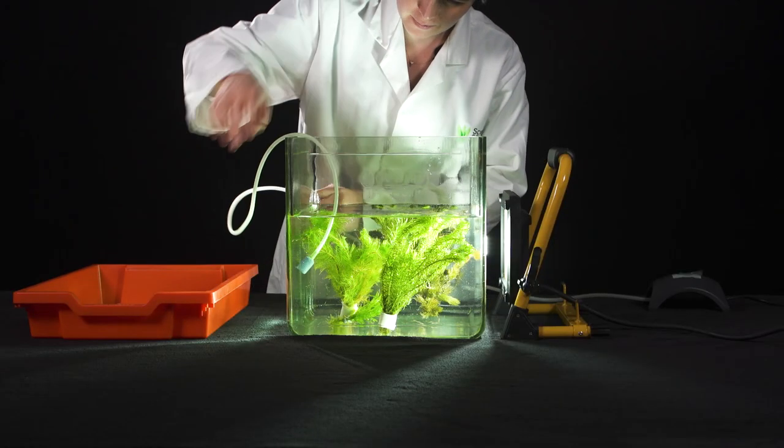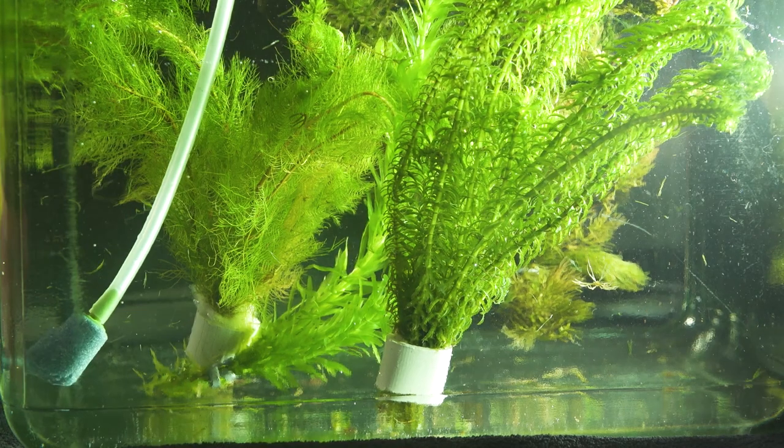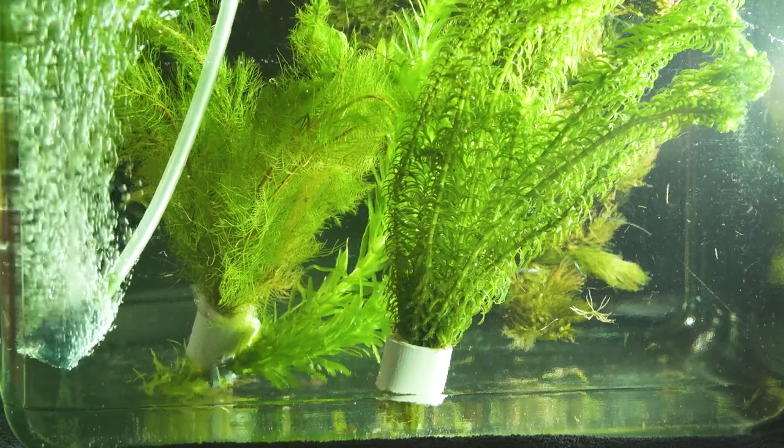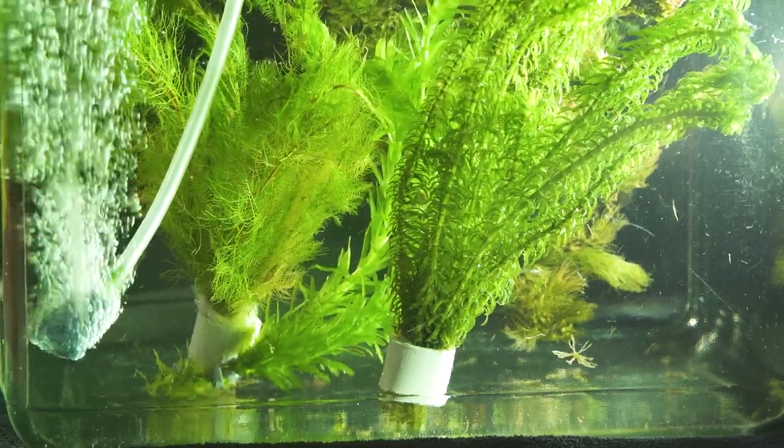The most important things when preparing for this practical are to find a reliable pondweed supplier that works for you, in your particular location, and at the time that you want to carry out the practical, and that you plan your purchase or collection.